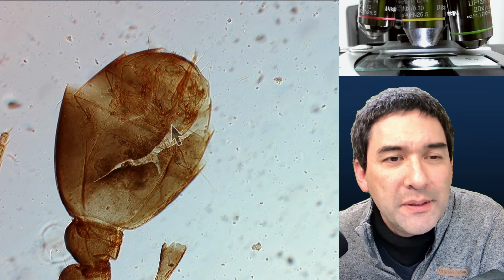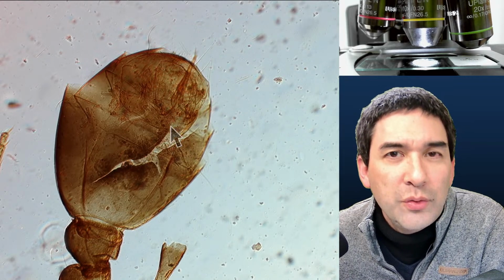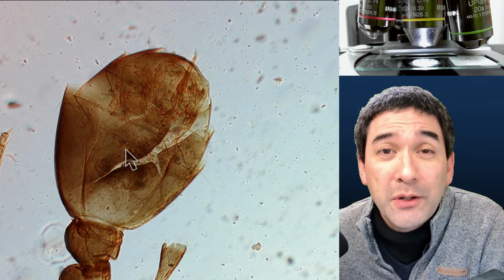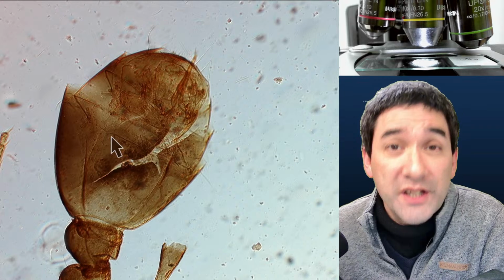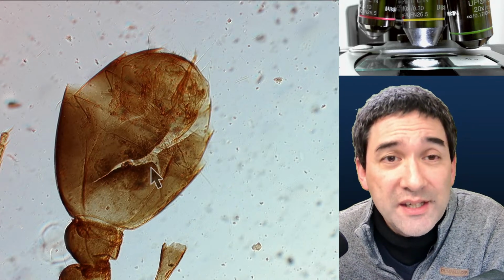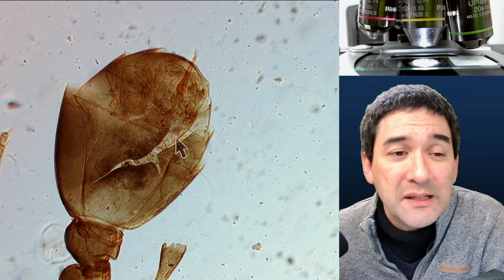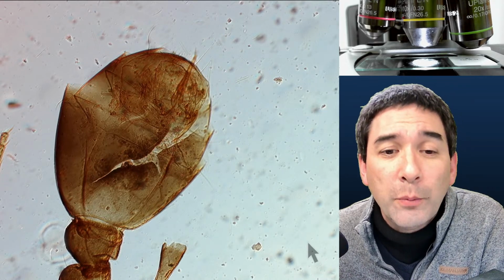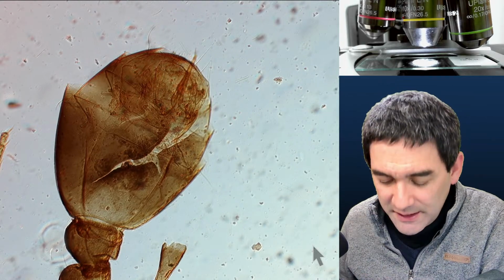Now this actually happens when you compress the insect. So it could be that they treated the insect in potassium hydroxide. That's one possibility, because potassium hydroxide makes the insect very soft and also transparent. And then when you squeeze it, it can break open and the contents spill out. And so this simply explains why it's torn and ripped open here, right? So that's the one.